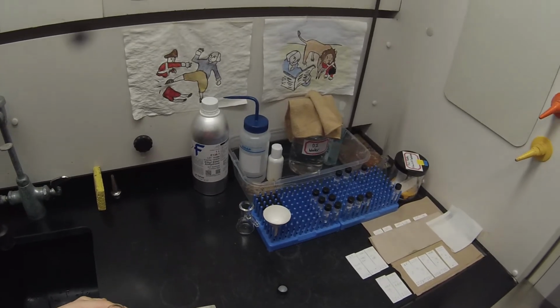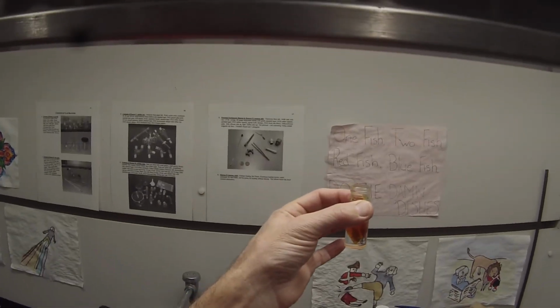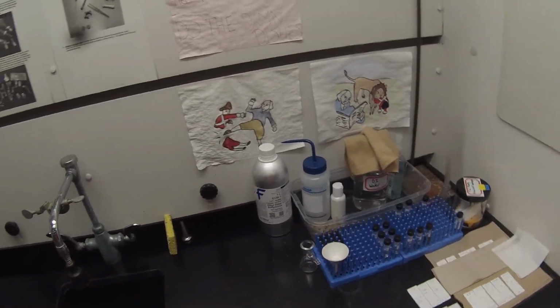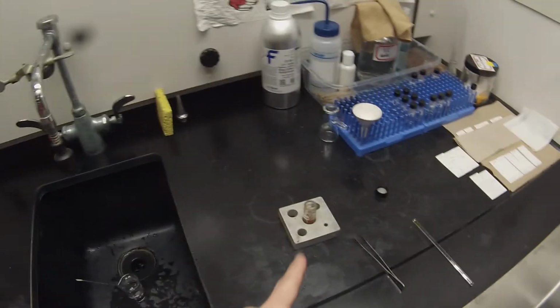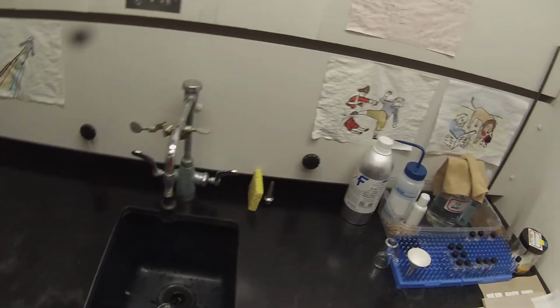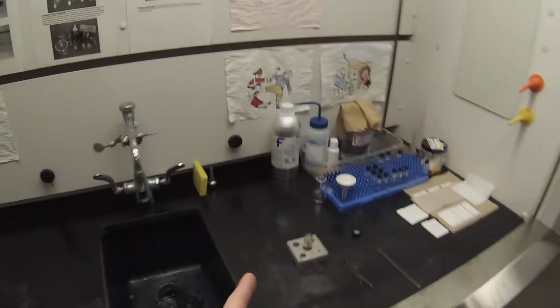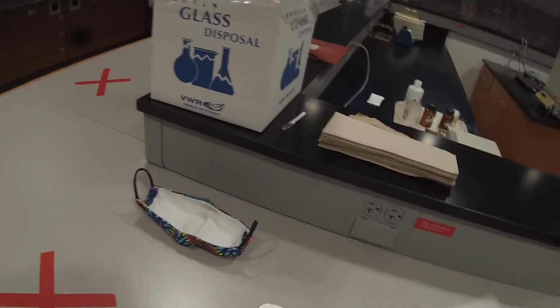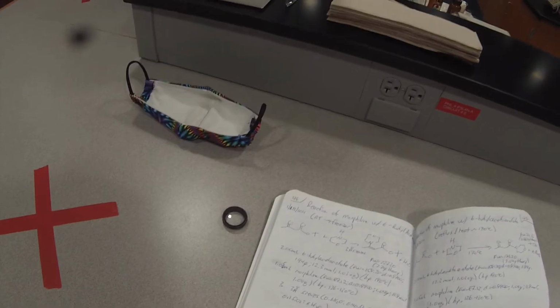So what we're going to do, it's about just a little over 2 milliliters, is sit and let some of the ether evaporate. But the other thing we can do is add a seed crystal. Now, we don't have a seed crystal of the compound that we're looking for, but we do potentially have seed crystals of the other compound, the compound from the cold reaction, which is 46B.